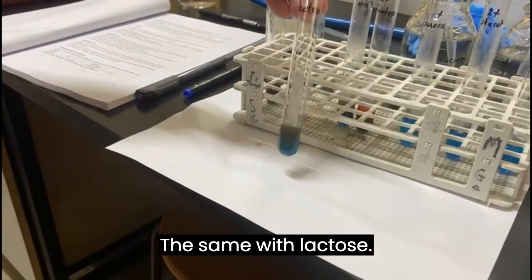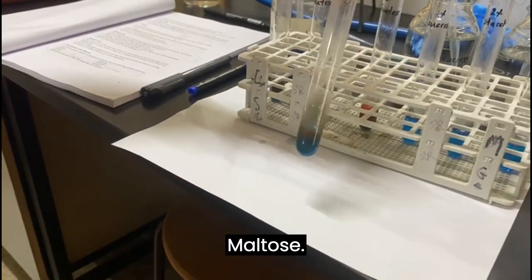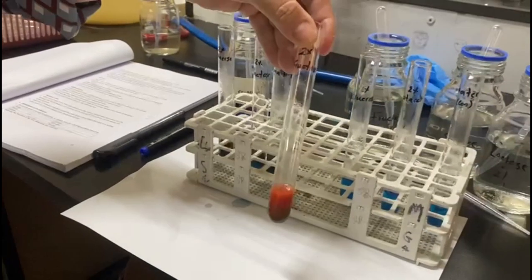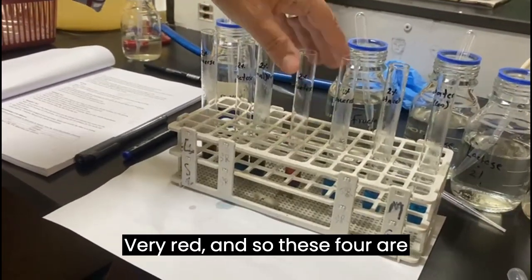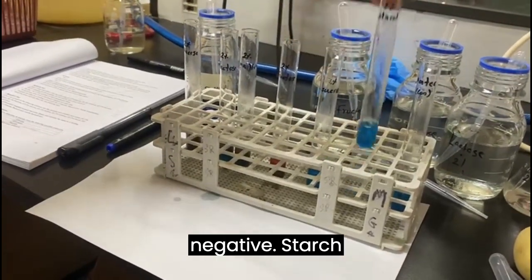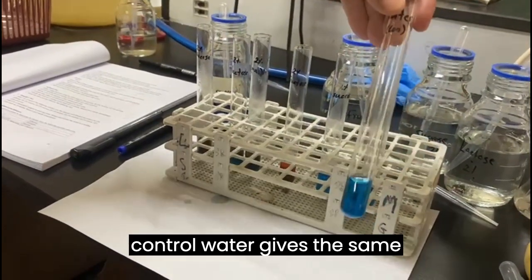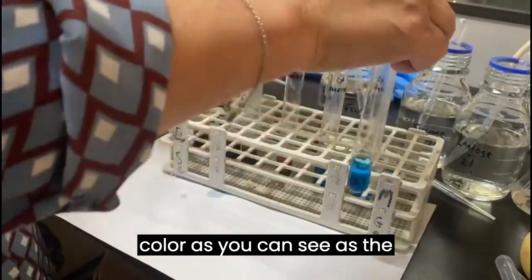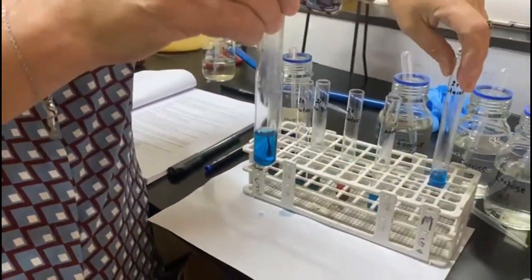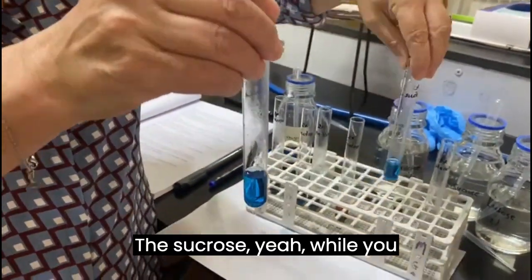The same with lactose, maltose. Fructose is the prettiest, very red, and so these four are positive. Sucrose is negative, starch is negative, and our negative control, water, gives the same color, as you can see, as the starch and the sucrose, yeah?